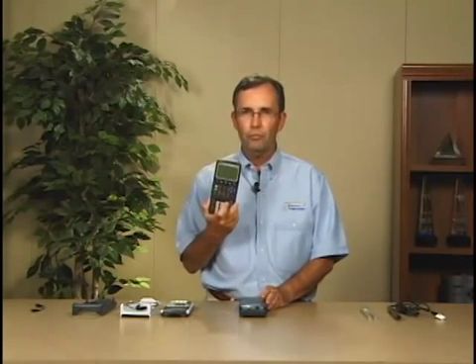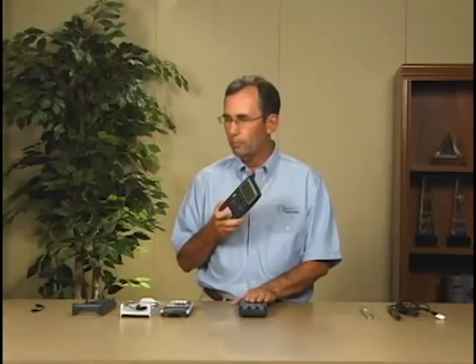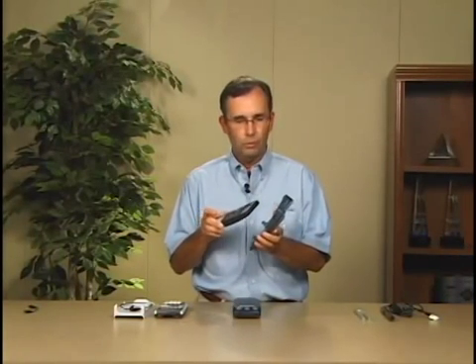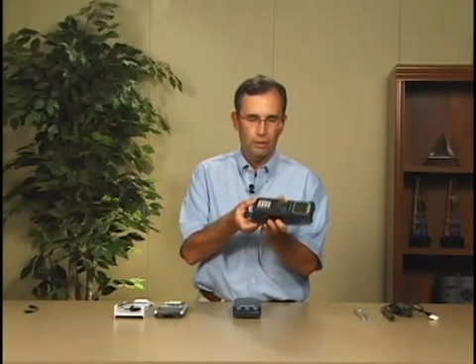For example, it supports the TI-83+. When you purchase a LabPro, it comes with the necessary equipment to connect your graphing calculators to the LabPro. This cradle right here allows us to use the TI-83+. To connect the pieces together, all we do is slide the top of the calculator into the top of the cradle and snap it down.